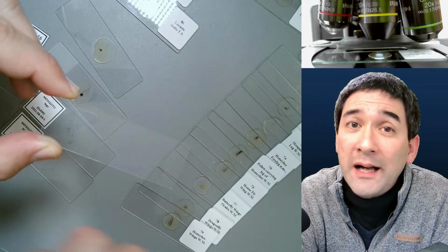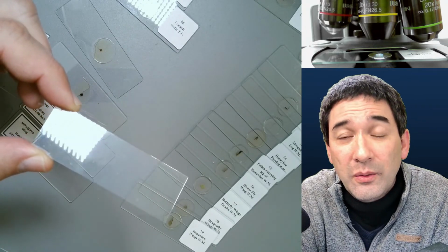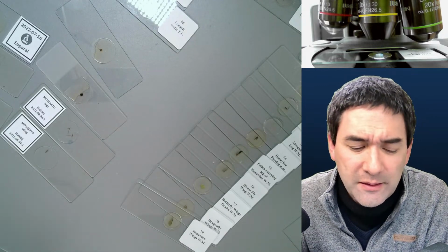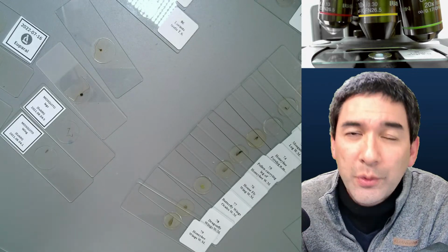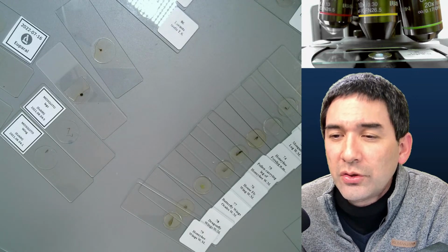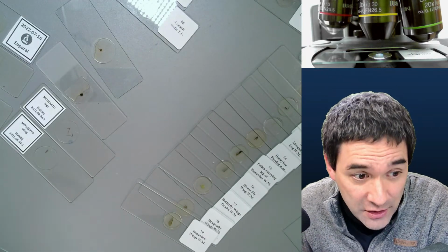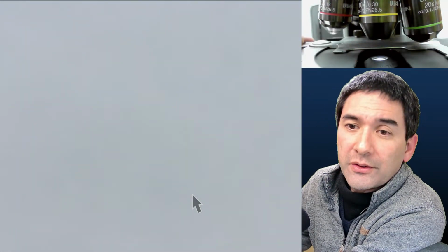And if you add a mounting medium, you have to really make sure, and you have to experiment a little bit, which one will not dissolve the crystal structure. So that is a little bit the issue here. And I know that vitamin C dissolves a little bit in alcohol as well, so you have to be a little bit careful. I would experiment. But the first thing that I would try is to preserve them a little bit using a dry mount. And I also have to say something: vitamin C likes to oxidize in air. So putting a cover glass on top of it or making a permanent mount might also preserve it better.